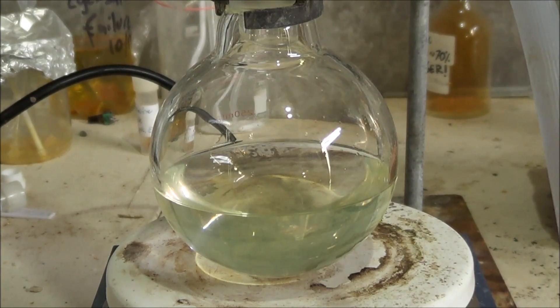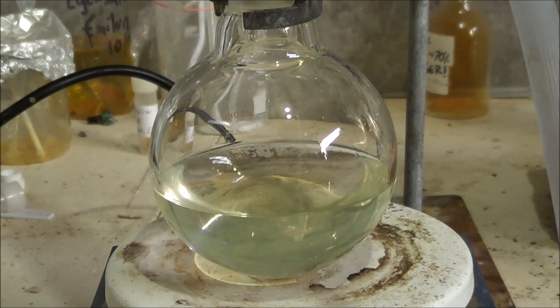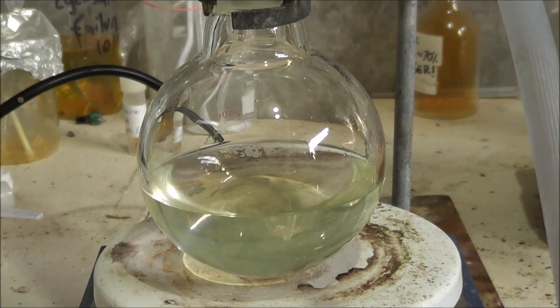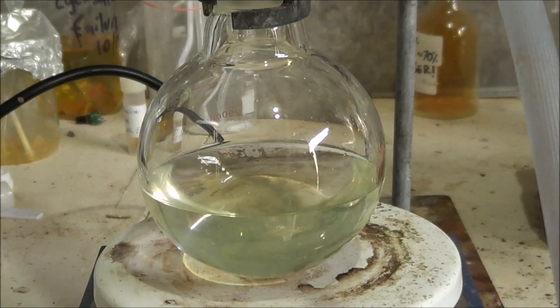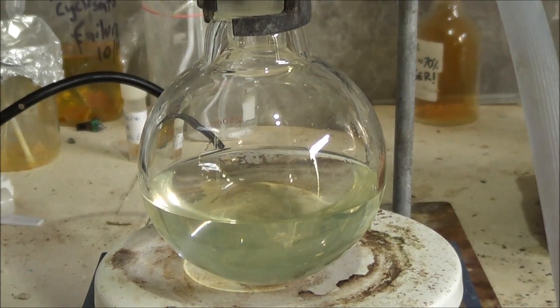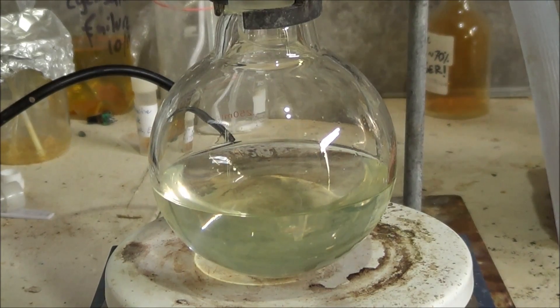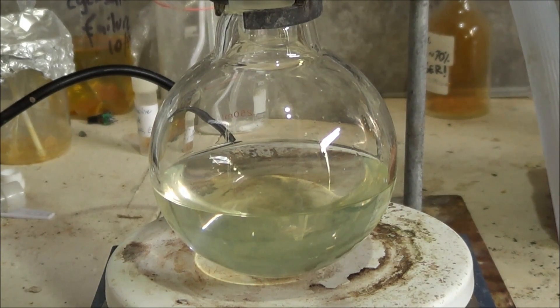So less than 10 minutes later and we're done. It's all reacted. We can't see any more bubbling. I mean, we're going to let this sit until it finishes cooling. It's quite warm to the touch. And then, yeah, that's a lot better than reacting it in a jar.